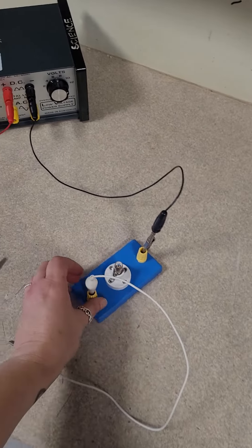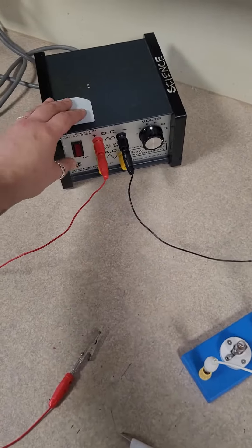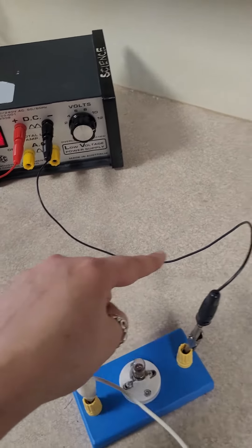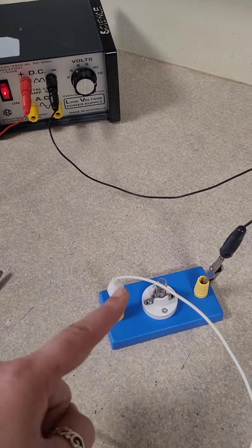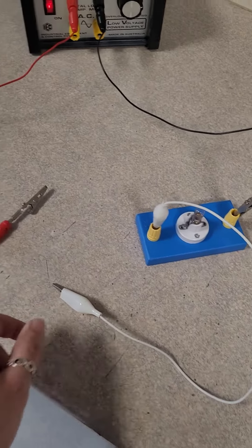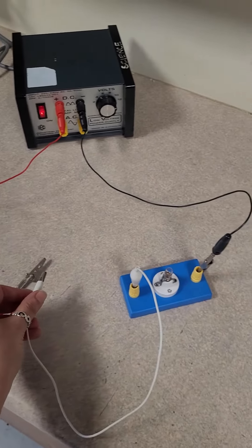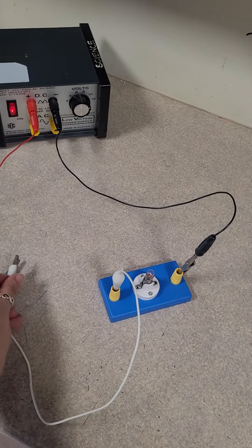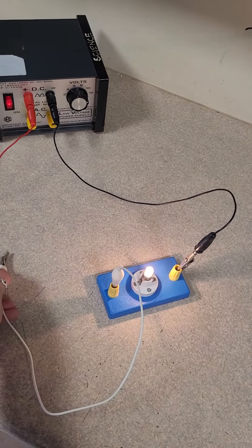Okay, we have a simple circuit here on 12 volts. If I close the circuit, light goes on. Closed circuit, light goes on. Great.